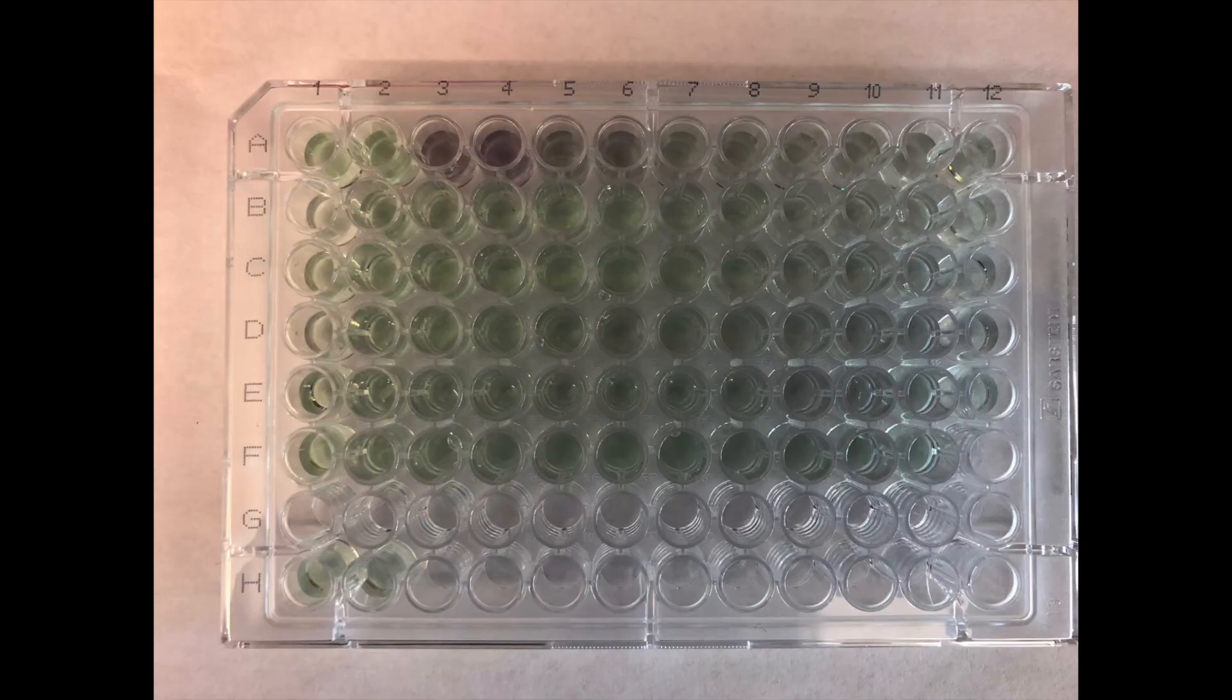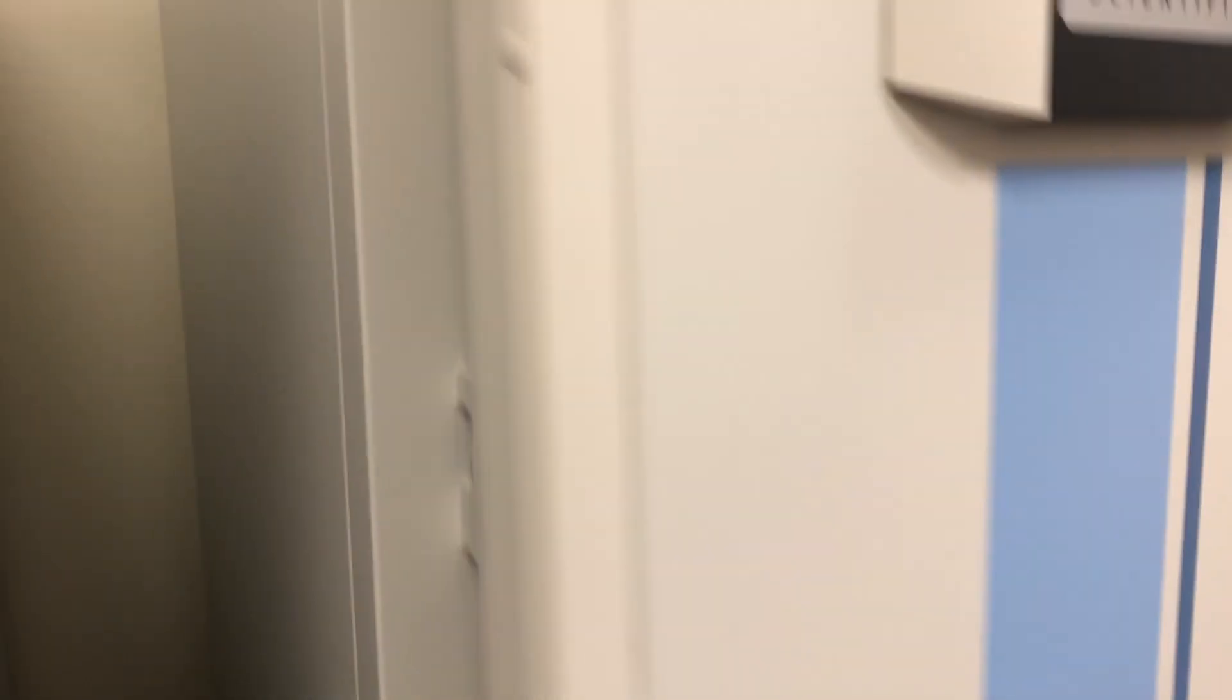Once the plate is filled, I put it in the incubator for 30 minutes to help the reaction with the copper happen faster.